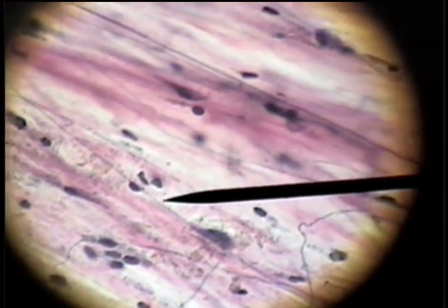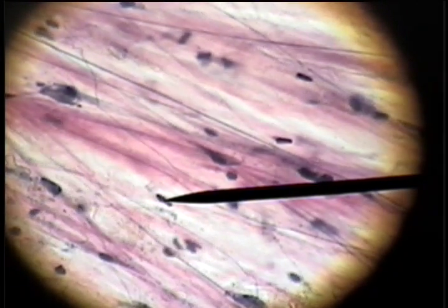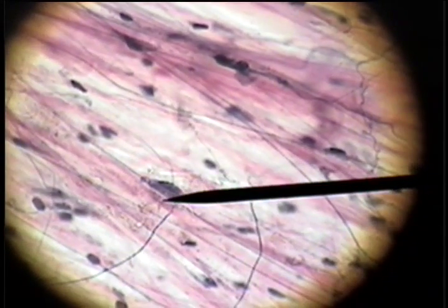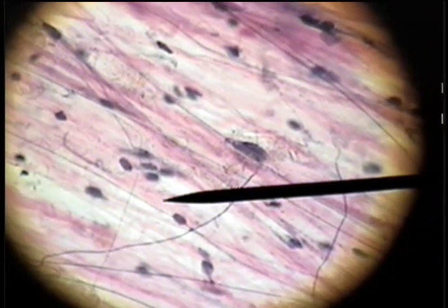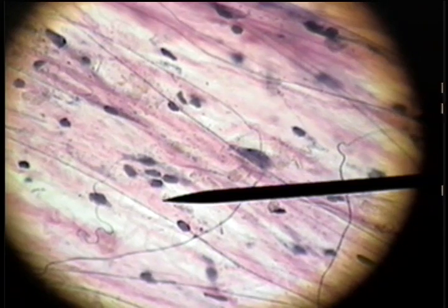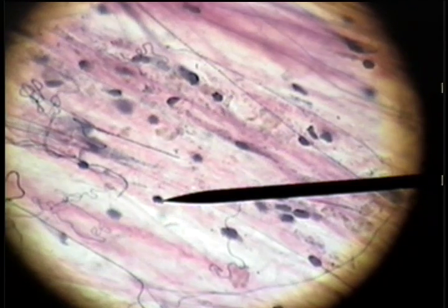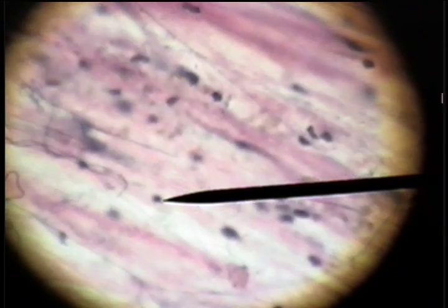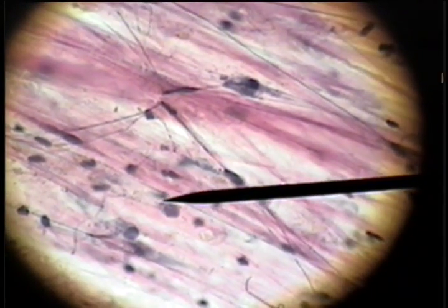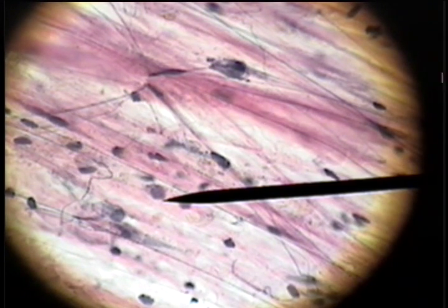Of the cell types, the ones that are narrow and thin like this are fibroblasts. Then we have a cell that has a small, dark nucleus — those are macrophages. And a cell that has a large nucleus and granules in the cytoplasm is a mast cell.